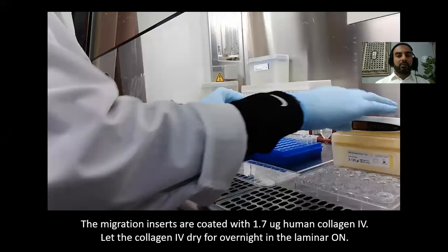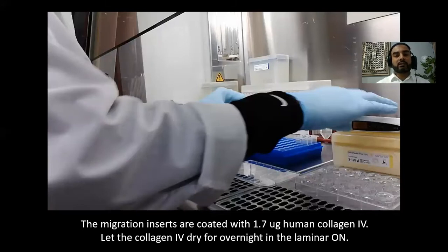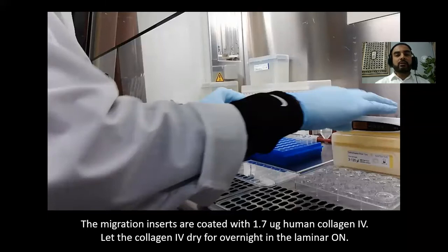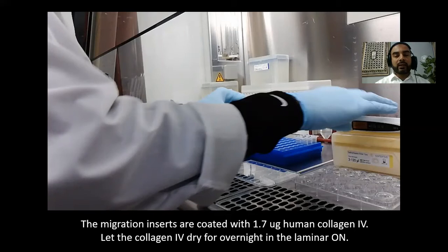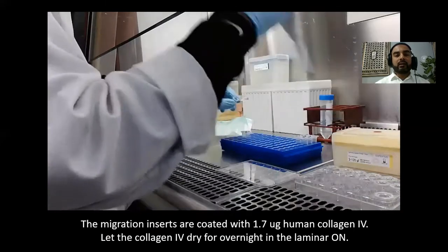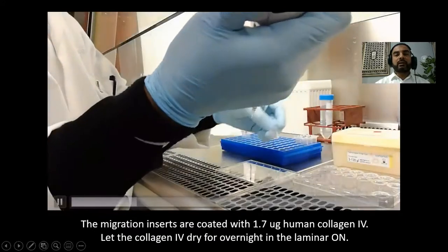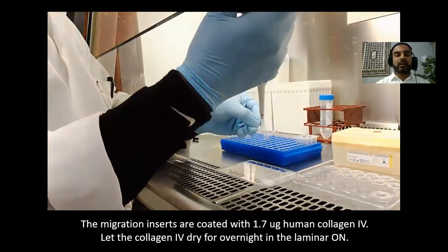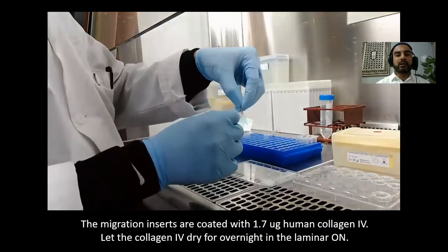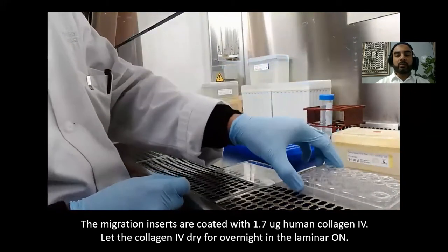For the migration assay, we are assessing not only the migration but also the invasiveness of the cells. As we discussed before, when a cell starts migrating, the cellular machinery activates, the cell begins migrating, and then it invades the collagen — which is the connective tissue surrounding it. It secretes enzymes that digest the connective tissue, then migrates from one tumor space to a distinct part of the body. This is cancer spread — metastasis.